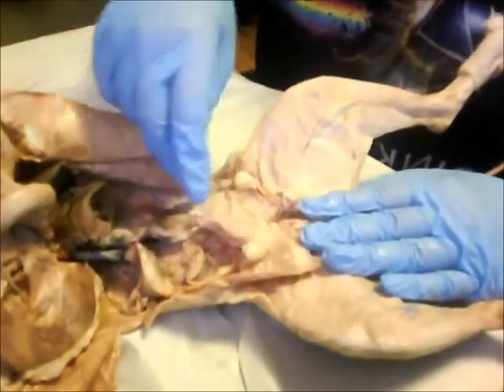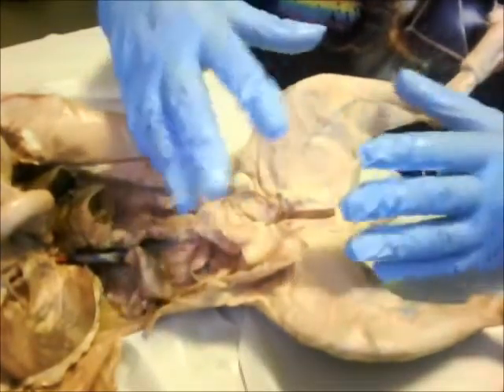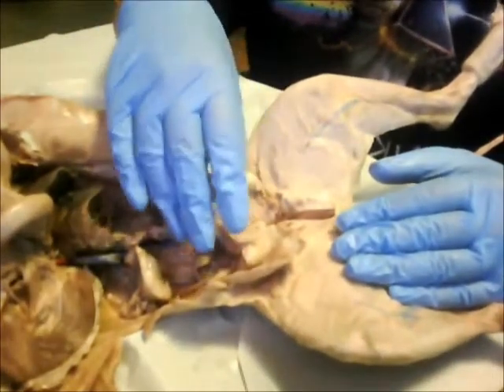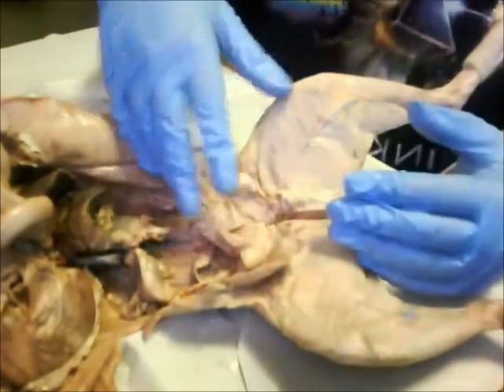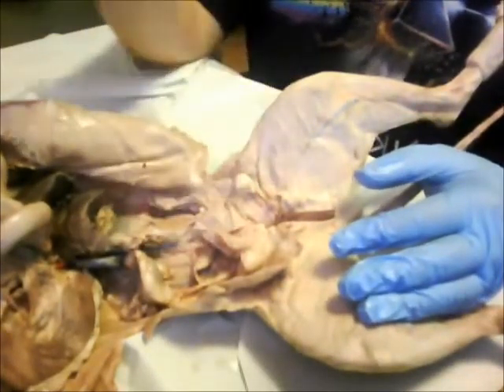Inside the urinary bladder you'll have transitional tissue which helps the bladder stretch, and you'll see the transitional tissue, or rugae, it's similar to rugae I guess, in the stomach, because that allows the organ to stretch to accommodate its needs, or what it has to hold.